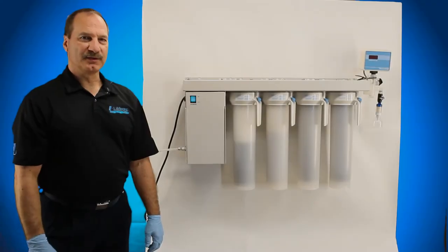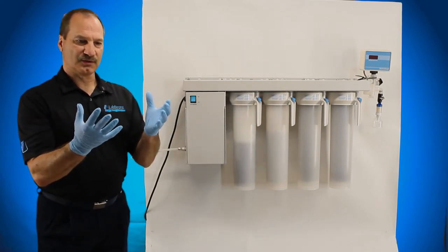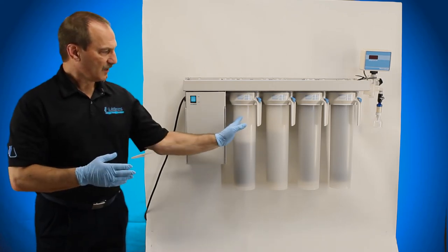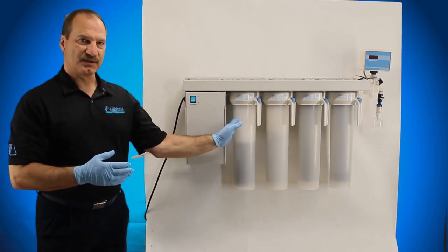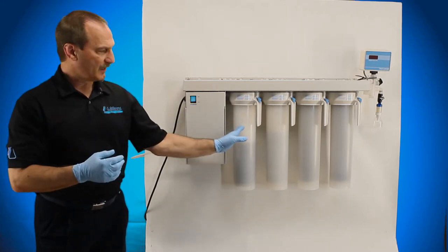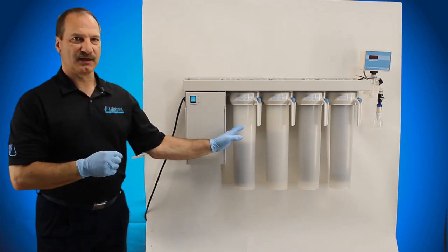The important thing to remember when you install the cartridges in an ePure system is to always use gloves because you don't want the oil off your skin and the sodium to actually start doing anything to the cartridge because the purity will start to drop off quite a bit. If you use gloves you won't contaminate the outside surface of the cartridge because your water is going to pass along the outside surface of that cartridge.